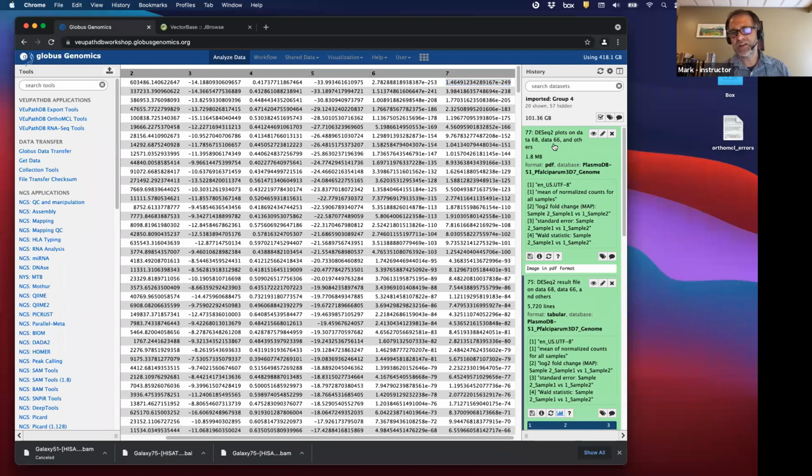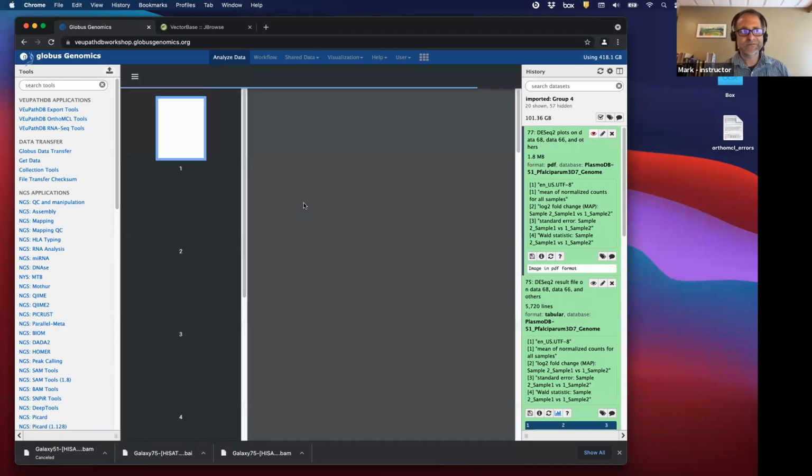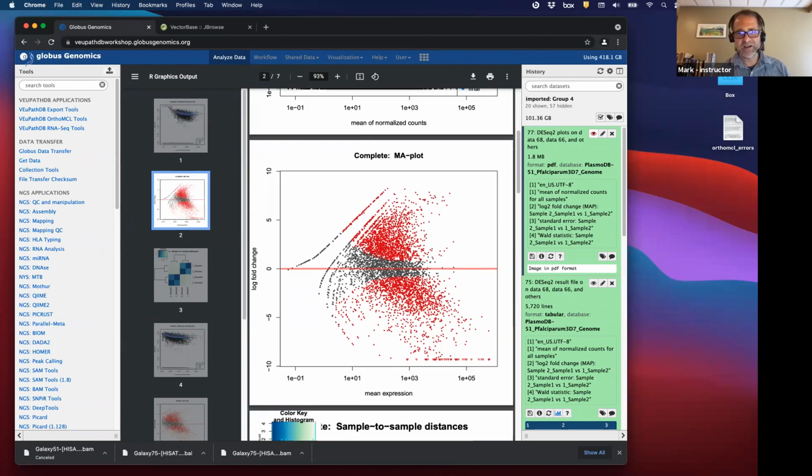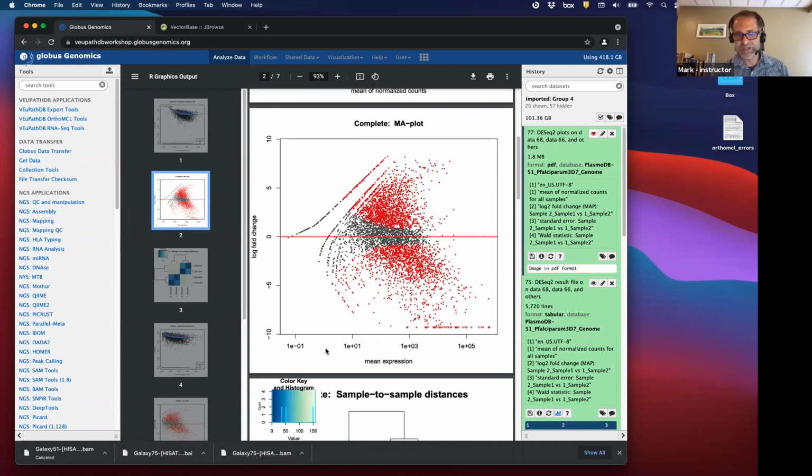There's another way to look at the DESeq2 results as a whole. You may wonder what's going on with all the genes as a whole. And this set of plots is really useful. I'm just going to focus on this plot right here. So this is mean expression. These are really lowly expressed genes. These are highly expressed genes. And this is the fold change. Is this gene going up or is this gene going down? And in red are the ones that are significantly changed. So you can see that the bigger change there is, the more significant they are. But as you get to higher expressed genes, you don't need that much of a fold increase or fold decrease to get a significant change, because the reads are so much that it aids the statistics.